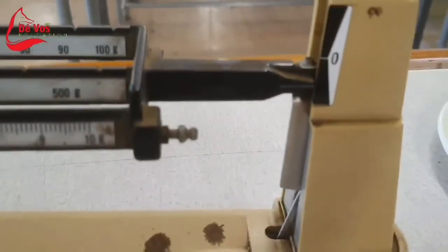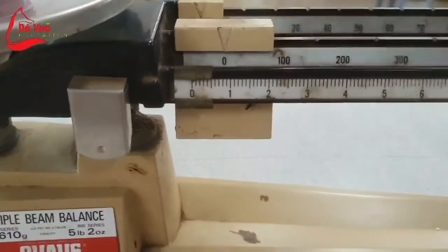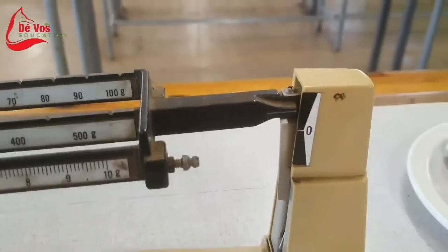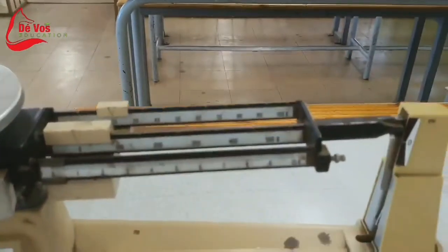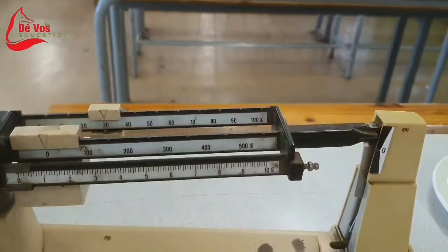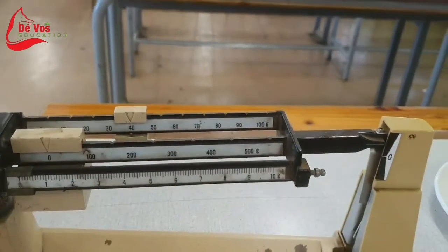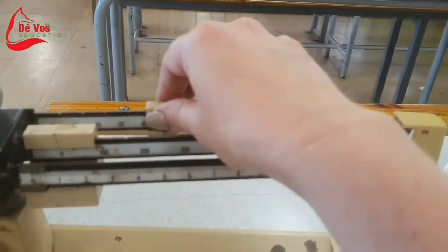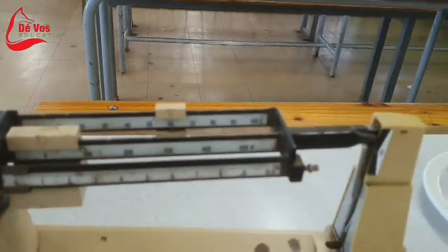After you've placed it in the vinegar overnight, you'll notice that the egg has already swollen up slightly, meaning that there's already water that has moved into the egg. Although it's faster and easier to determine the weight of the eggs on a digital balance, I prefer to use the triple balance scale system. This can make it more visual for the learners understanding the concept of balancing out 2 weights.